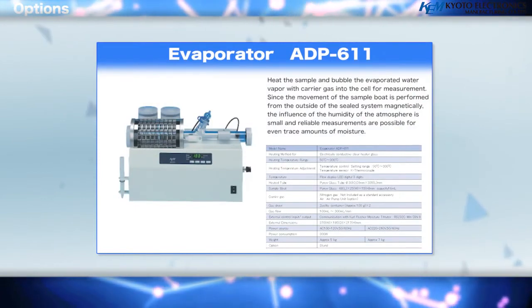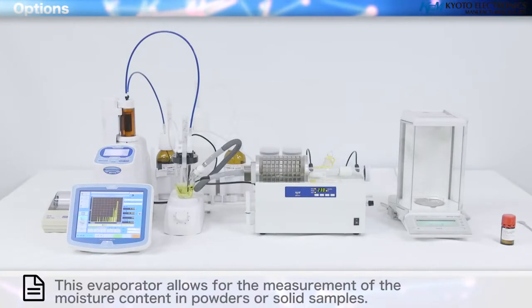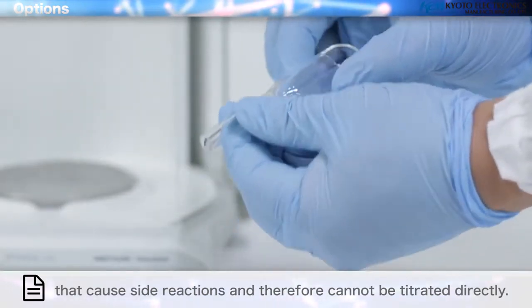Evaporator, ADP 611. This evaporator allows for the measurement of the moisture content in powders or solid samples that cause side reactions and therefore cannot be titrated directly.